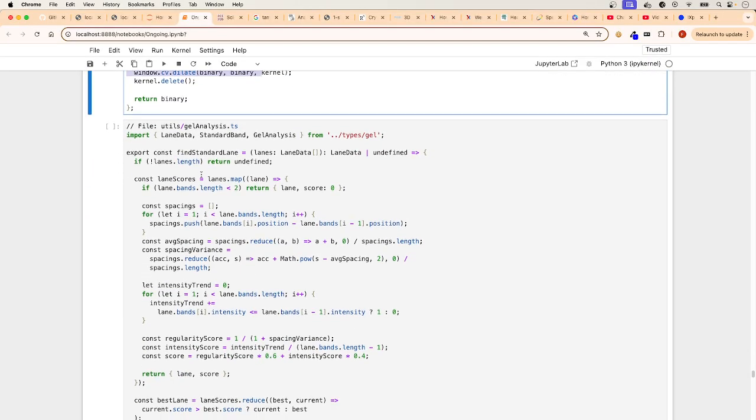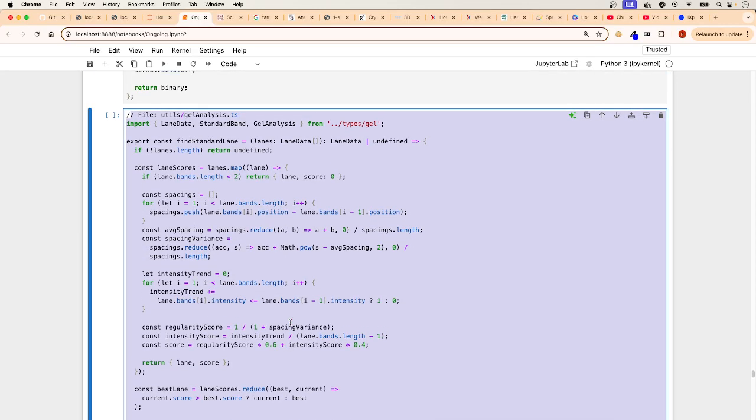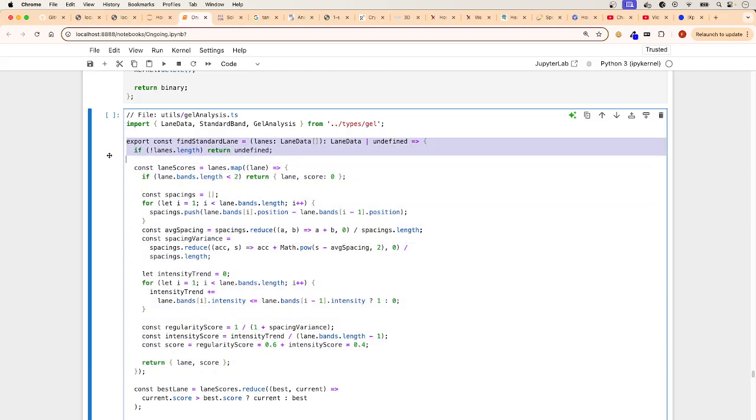Then it gets into the gel analysis. This is where all the magic is happening here. Because basically it's finding your ruler. And what do I mean by that? When you make a measurement with a ruler, you look at the ruler and the first thing you look at is, is it a centimeter ruler? If you're in the United States, is it using inches? Is it using centimeters? So that's the first thing you do. You look at the spacings and you see, oh, it's an inch. Oh, it's a centimeter. Oh, it's a millimeter, right? So this is exactly what it's doing here.